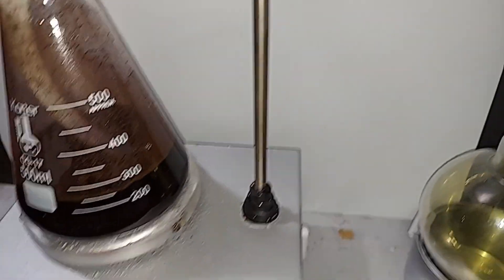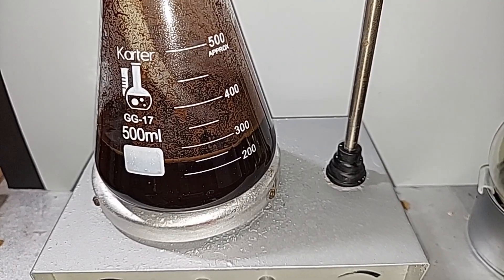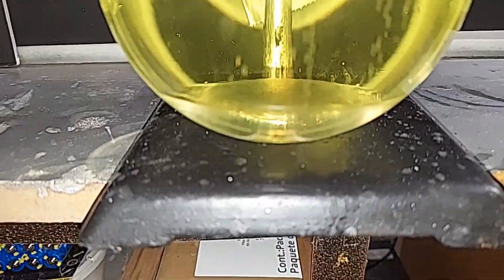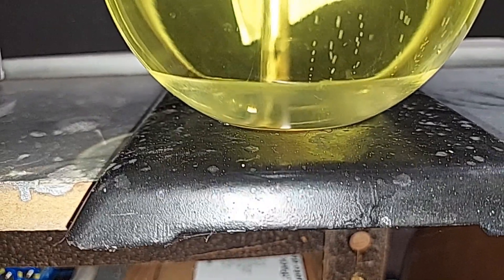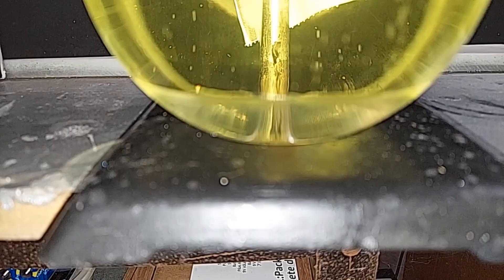I'm going to let it run for at least another hour so all the gas that was produced gets a chance to get in here. As this chlorine gas slows down, I noticed at the very bottom here there's a layer, which is salt and water, the other two products produced when you mix hydrochloric acid and bleach. It's pretty dense to sit on the bottom like that. That was pretty cool.